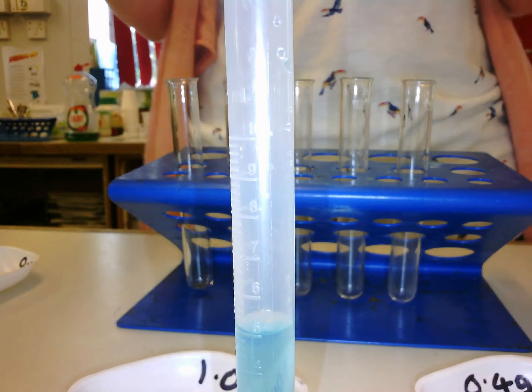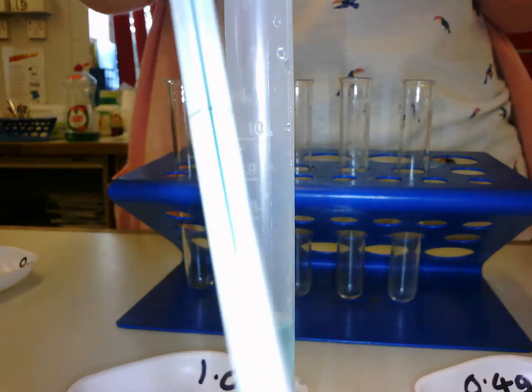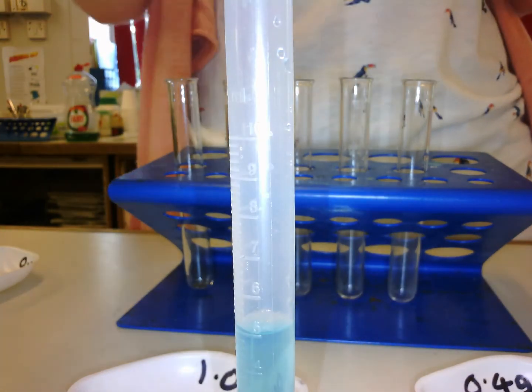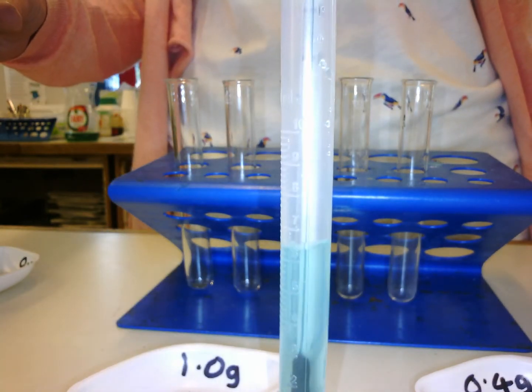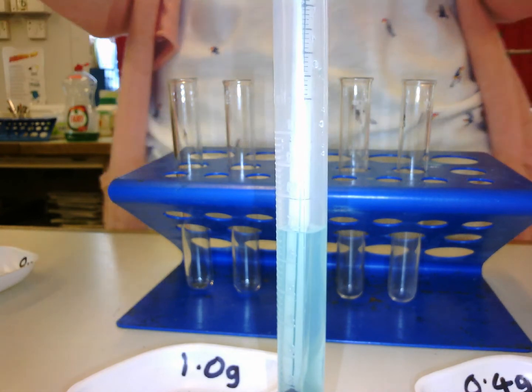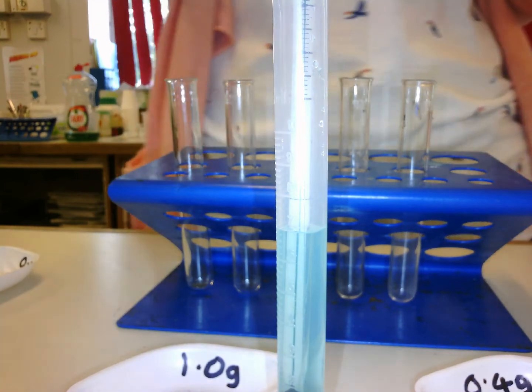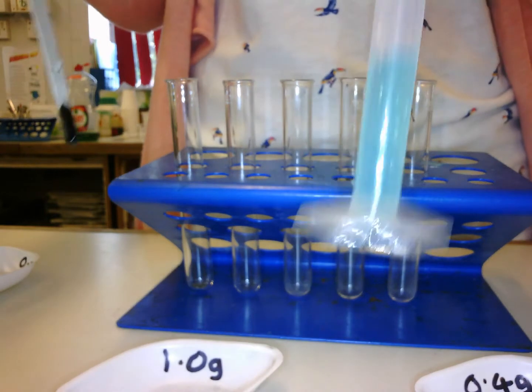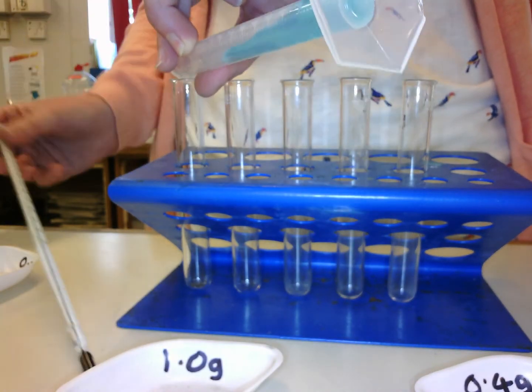It's an exothermic reaction. So if I'm measuring temperature, what I have to use is a thermometer, which I've got here. So the first thing I need to do is to take the temperature of the copper sulfate and record that in a table, and I will make this more clear when you are working in your book. Right, so the initial temperature of copper sulfate, and then what I do is I add it to my first measurement of iron filings.